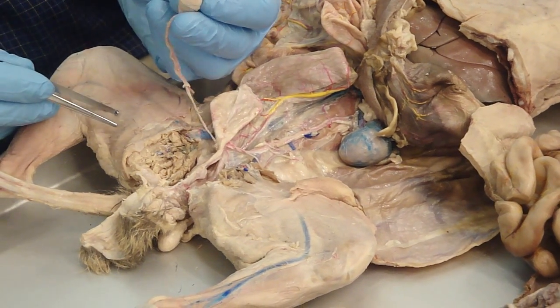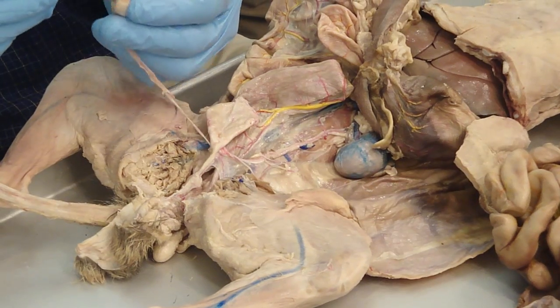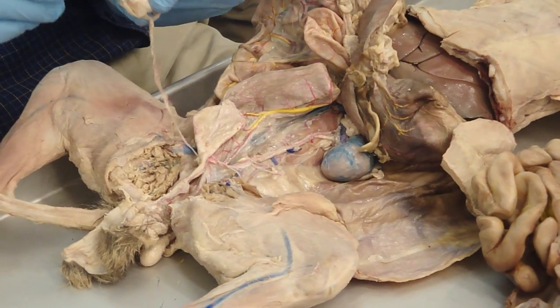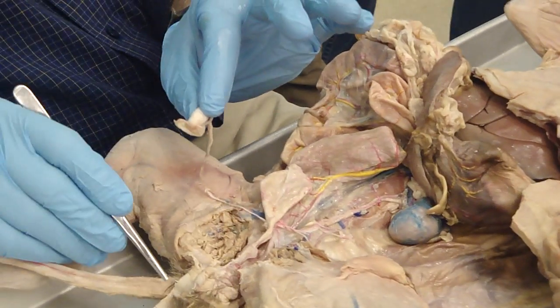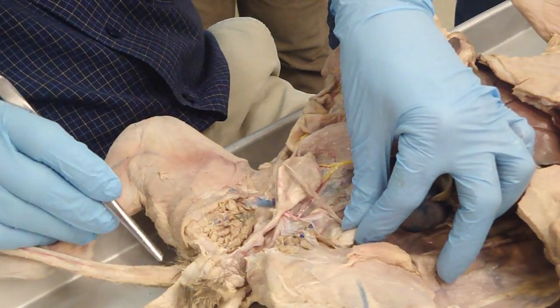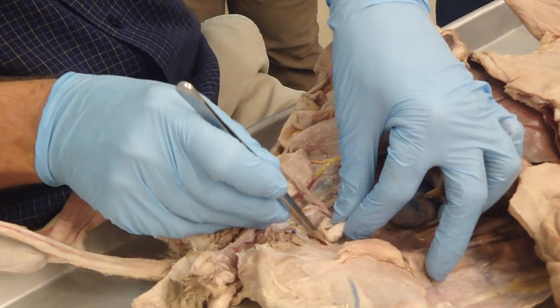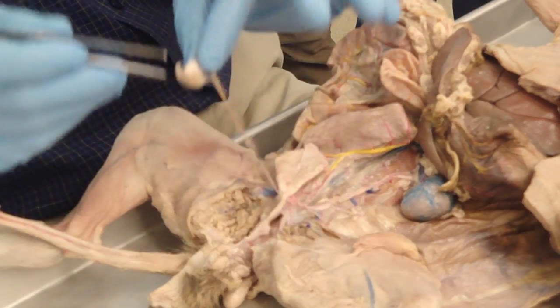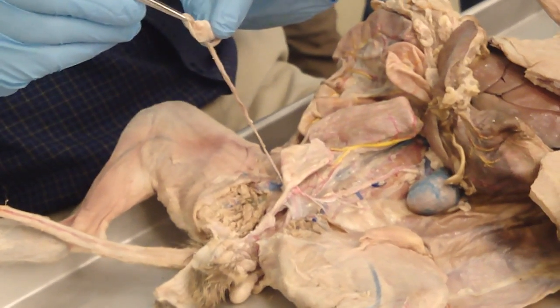So where is the gubernaculum now, that ligament? It is attached to the bottom of the spermatic fascia, there. Why is it attached there and not the scrotum? Because when the testis came to here, the gubernaculum was going through here and attached to here, it pulled down through it with it, and that's why it's attached to this fascia, and not the scrotum.